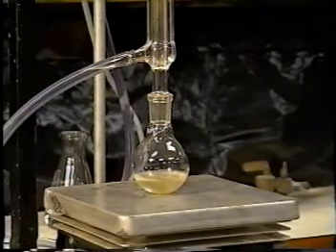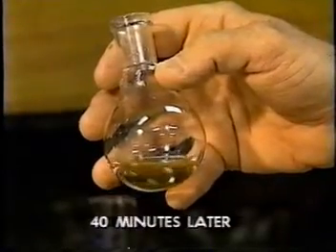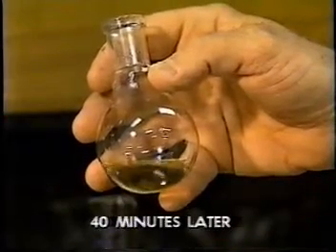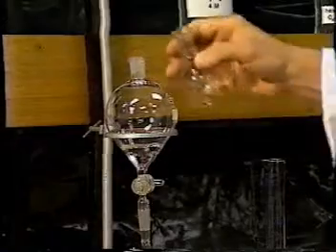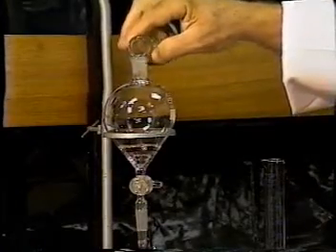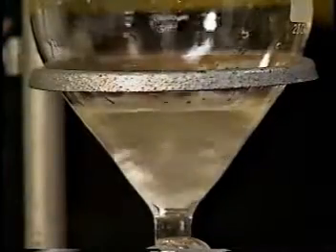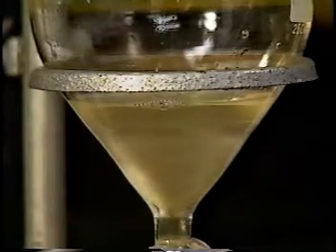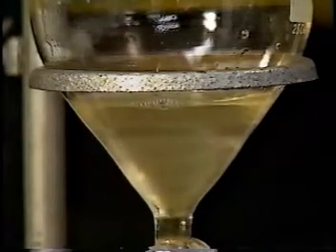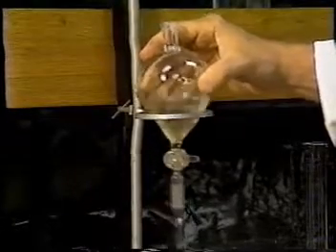Then it is cooled to room temperature. Our reaction mixture has now cooled. What we have to do now is extract our ester from the remnants of the reactants. First, we pour it into 20 milliliters of water in a separating funnel and swirl it around.